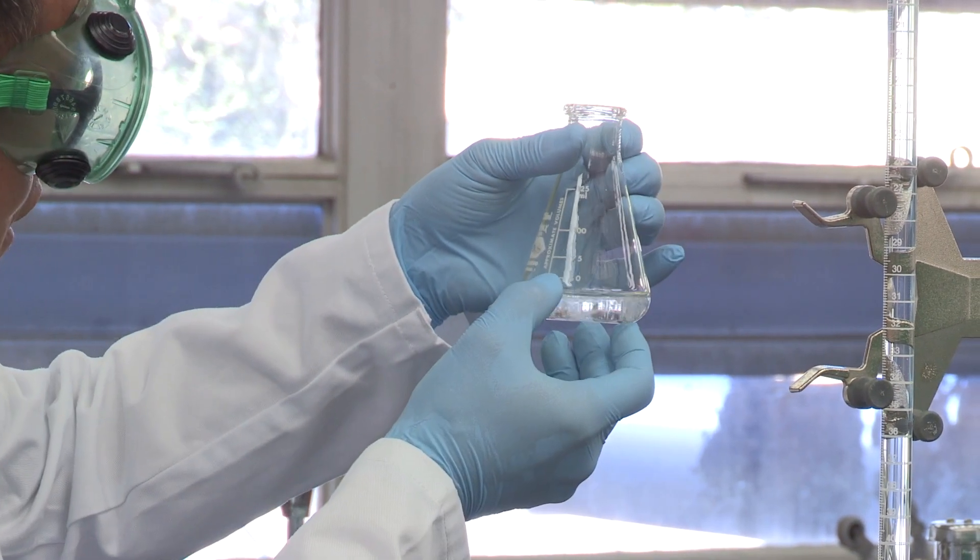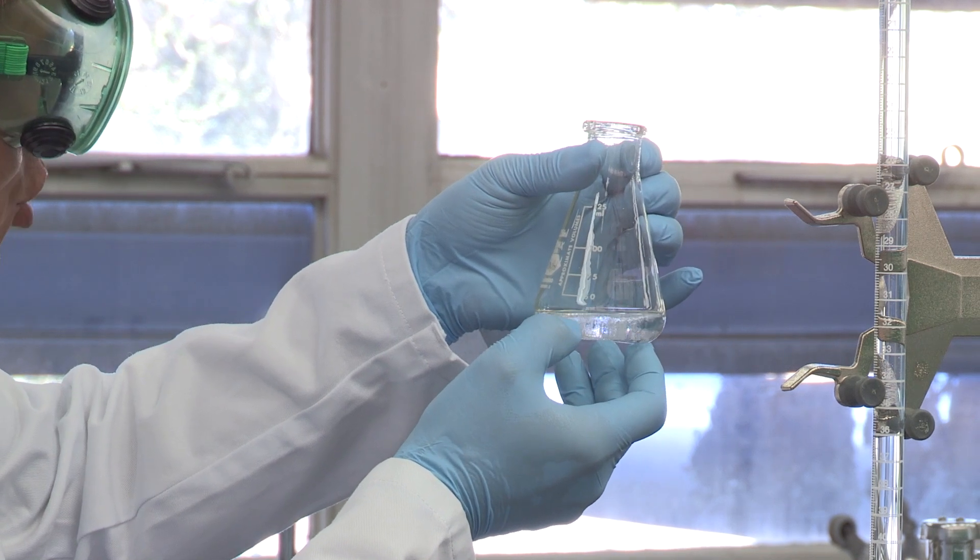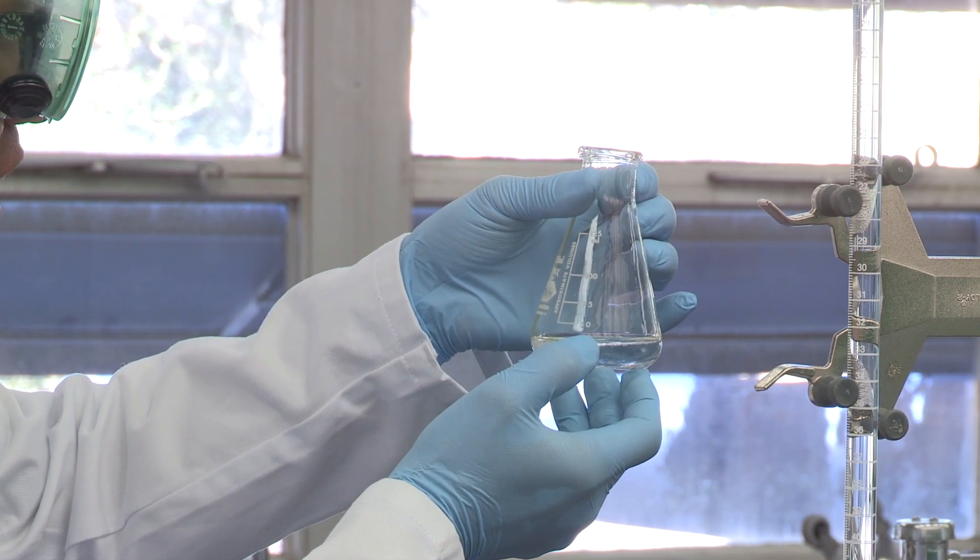Okay, this is 50. I add it to about half, so this should be about 25. Again, 25 doesn't need to be exact.